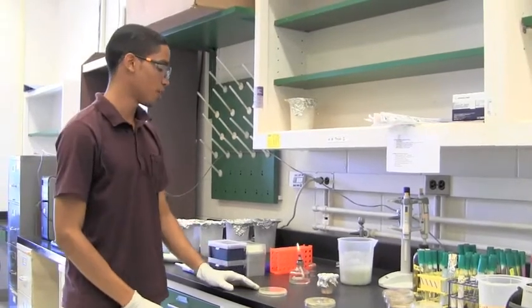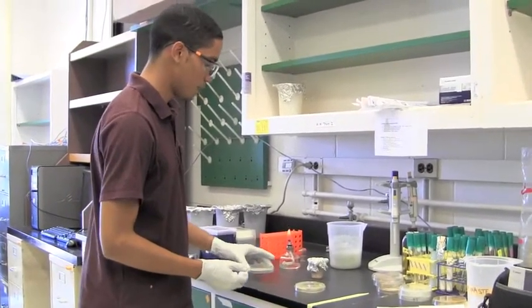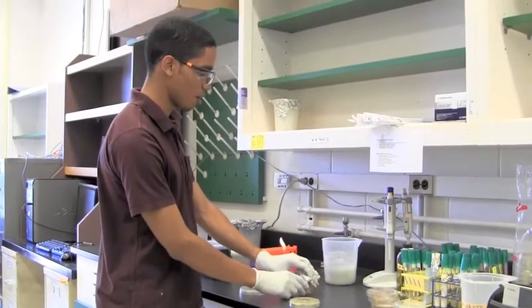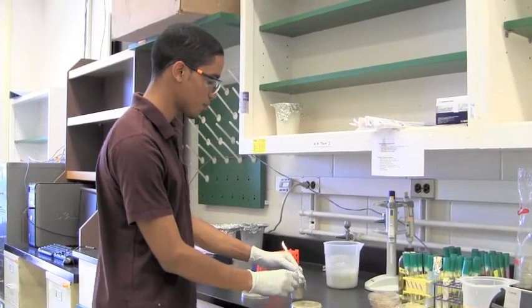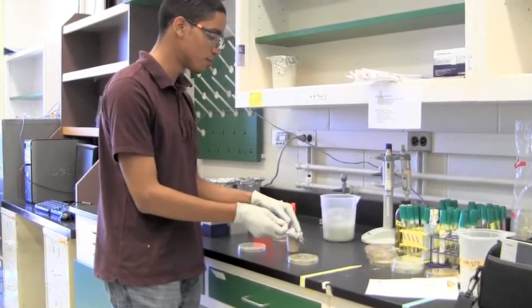As always, make sure that you're working under sterile conditions with your flame on. And the first thing we're going to do is collect a toothpick that is also sterile.